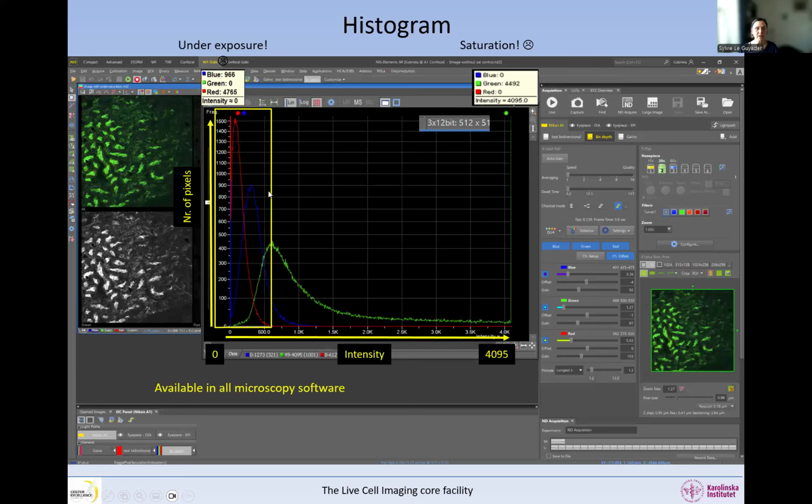So not good, we have saturation and underexposure in this image. And all what you can see here is that most of the photons that we have are really very much in the lower range. So this is the reason why the red and blue images were looking so dim, because most of the pixels there have a very low intensity. So it's not a very good, well-acquired image, that one.